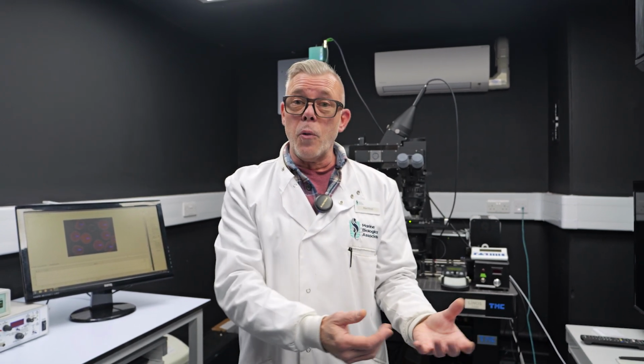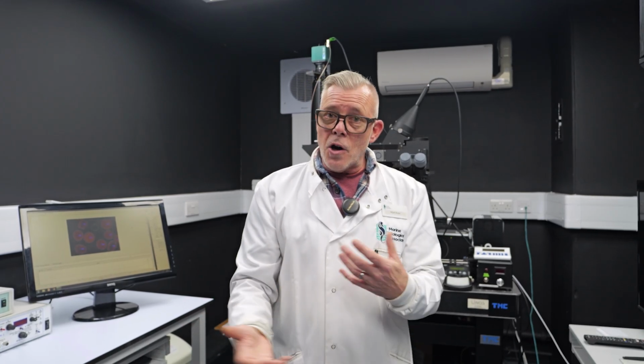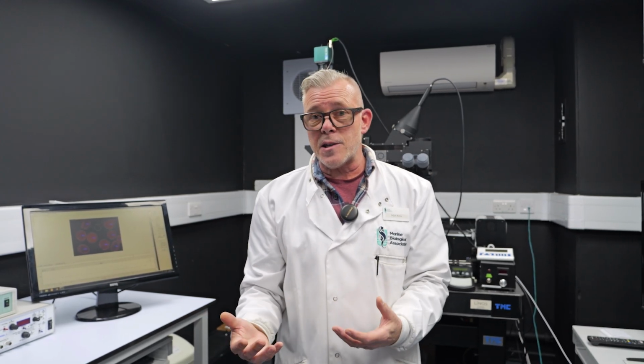and we use that single value to describe the photosynthetic efficiency of a whole sample. More recently, as chlorophyll fluorometry has progressed, we're able to actually start imaging chlorophyll fluorescence, and that's starting to allow us to delve a lot deeper into some of the chlorophyll fluorescence parameters that enable us to determine and estimate rates of photosynthesis.